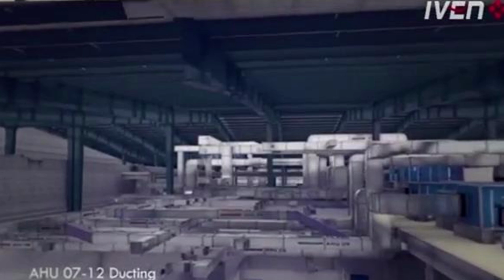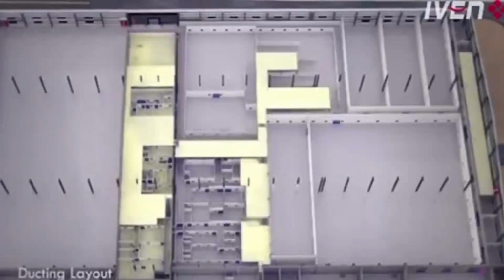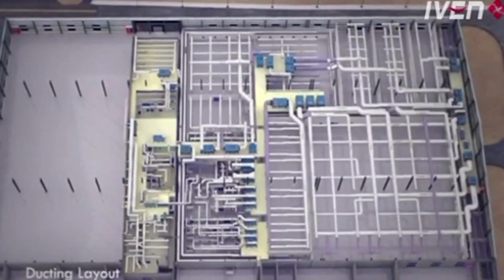Here are the air ducts. For our air ducts, the engineers mostly have more than 15 years of experience in air duct installation, because it's also a very critical part of the whole project. You can see the covering we are doing is very beautiful and neat.